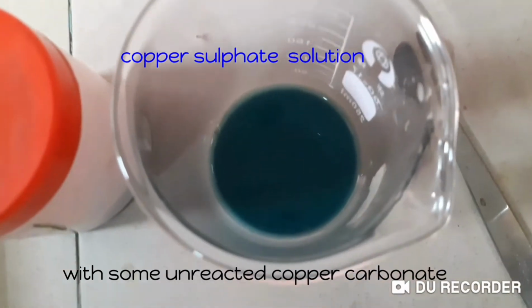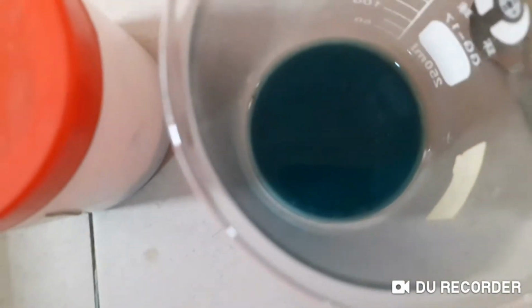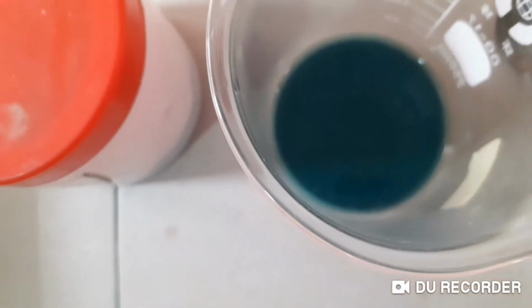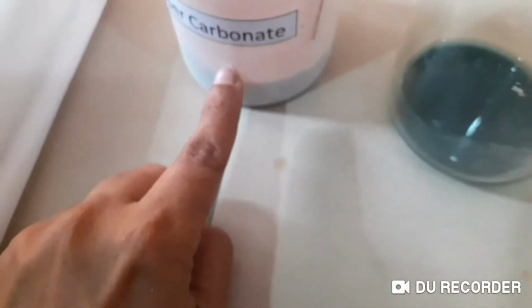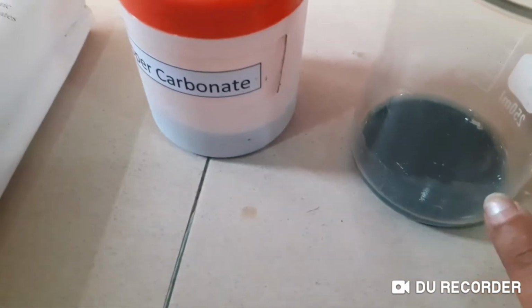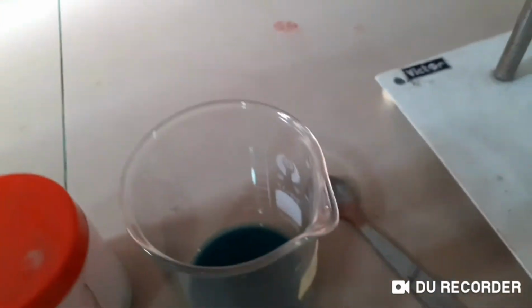That means we have got the product, but you know that this is not the copper sulphate's color, right? It's not nice blue because we have some copper carbonate remaining. Can you remember I told a word like I'm using copper carbonate in excess? I use the reactant in excess quantity, so I have some copper carbonate remaining. Now I want to remove that from this product mixture, right? So what I do is I have to filter.